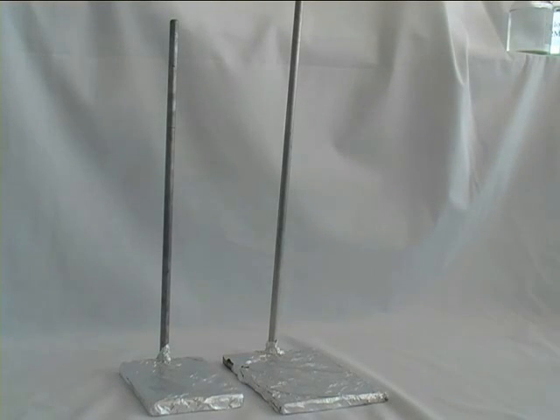The second part of this experiment involves an atmospheric pressure distillation. How to assemble the apparatus I will show you in this video.